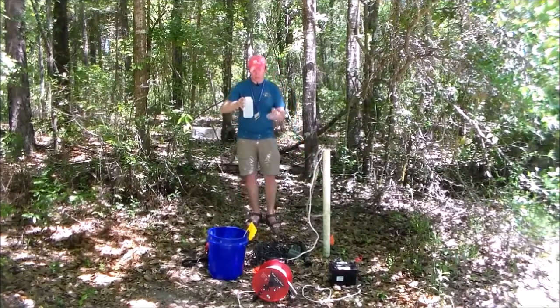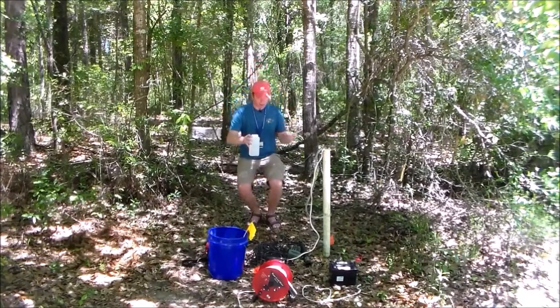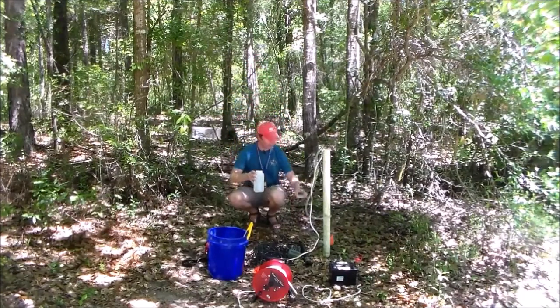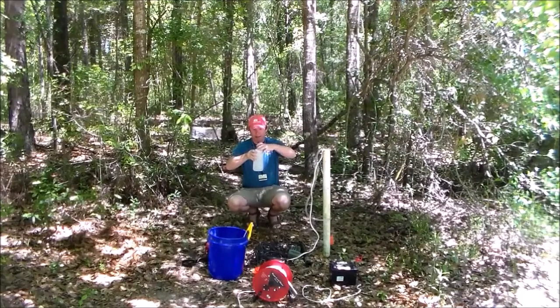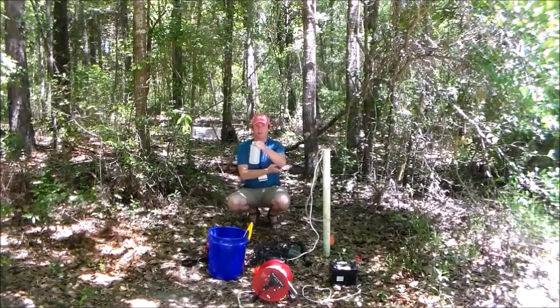All right, and I want to make sure that there's like a nice bubble of water up on the top, because when I put this cap on, I want to try and have as few air bubbles as possible. So it's hard to do with the larger bottle, but I'm actually going to fill the cap up with water too. And I'm going to put these two together and seal it and try and get as few bubbles as possible.